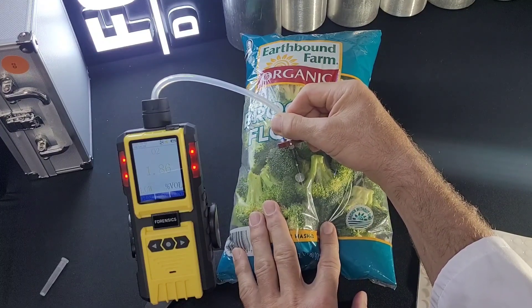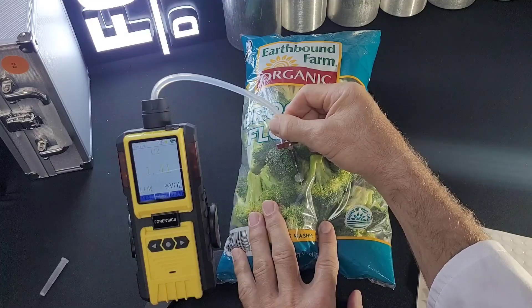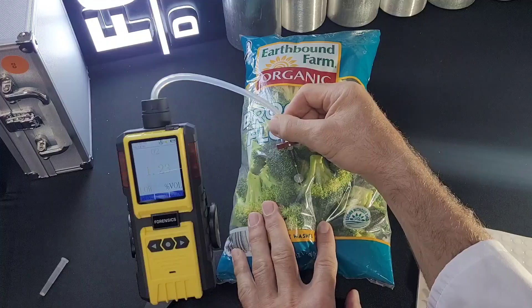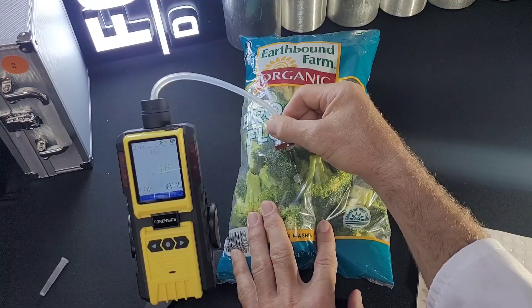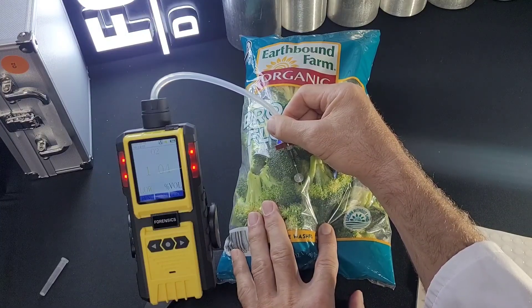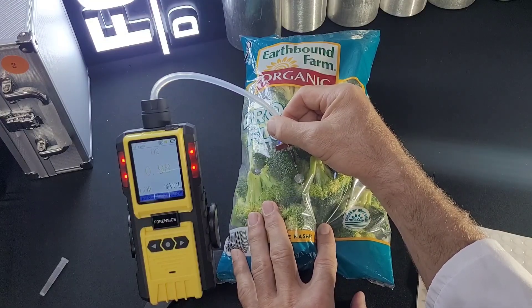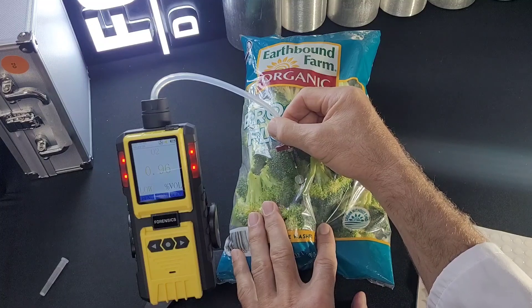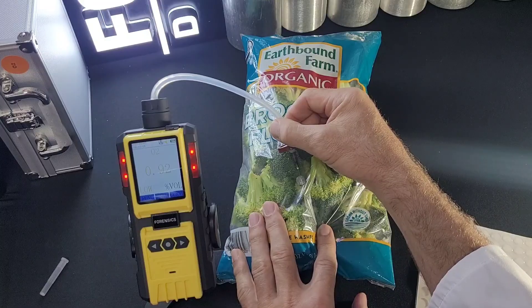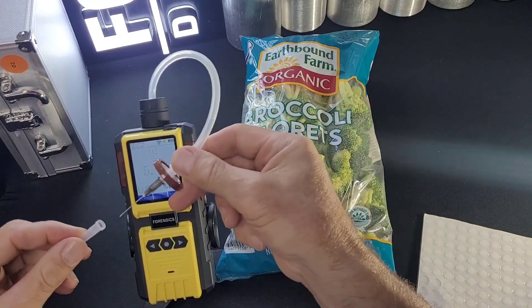I know this broccoli is flushed with nitrogen, and it's going down. A common question is: does the unit stop pumping and give a final value? No, it doesn't stop pumping. Give it a good 30 to 60 seconds and you will notice the oxygen levels will start to plateau — take that as your measurement. The lowest value will be your measurement. We're now going below 1%, confirming this is a very good oxygen flush. The numbers are plateauing and stabilizing at about 0.90. Within less than 60 seconds, I'll take the needle out and I am done with my oxygen analysis.